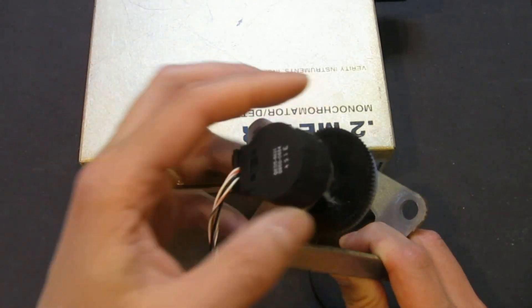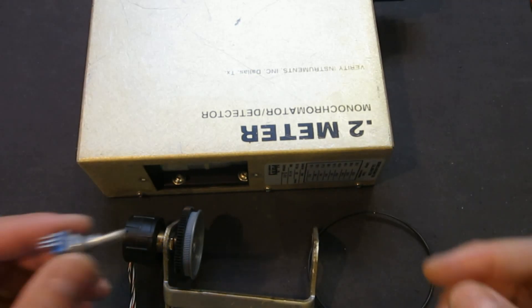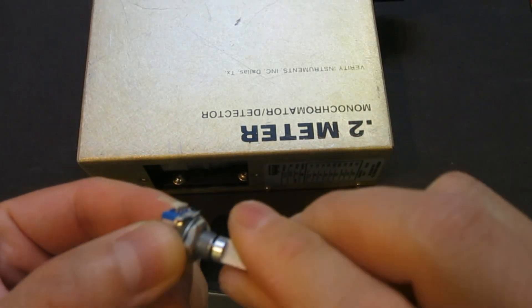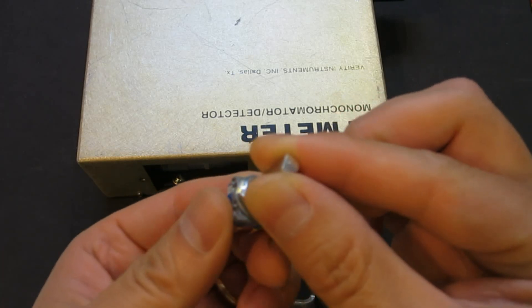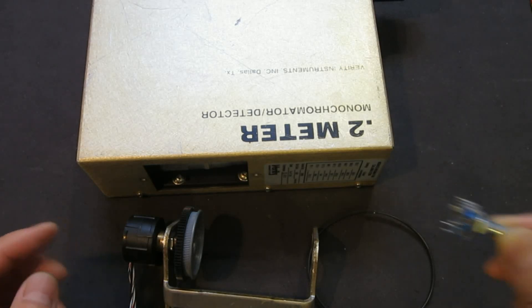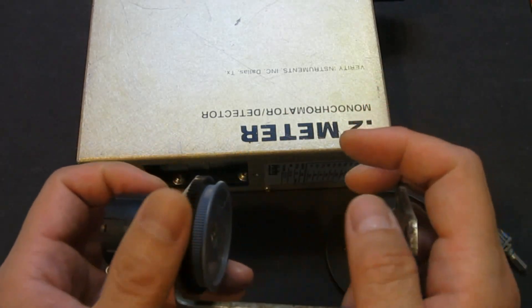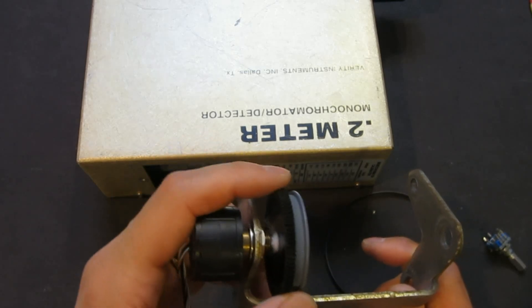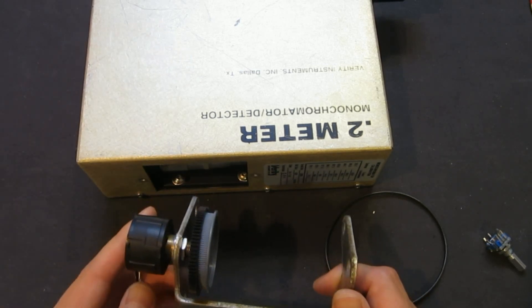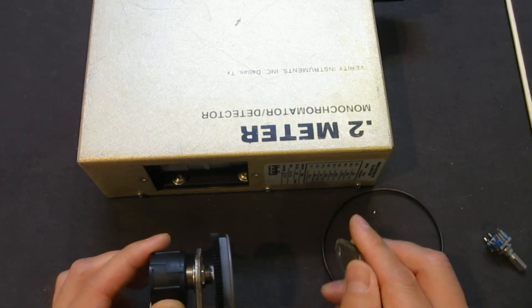Of course you can always use another type of encoder. Nowadays you can buy those cheap no-name brand encoders, but those will probably skip readings depending on the mechanical contact, and the resolution is probably not high enough. This one, on the other hand, is very high resolution. I did some tests and it registers roughly 10 ticks per nanometer, which is more than enough resolution for my application because the slit I made was roughly 0.5 millimeters, which translates to roughly 2 nanometers of optical resolution.